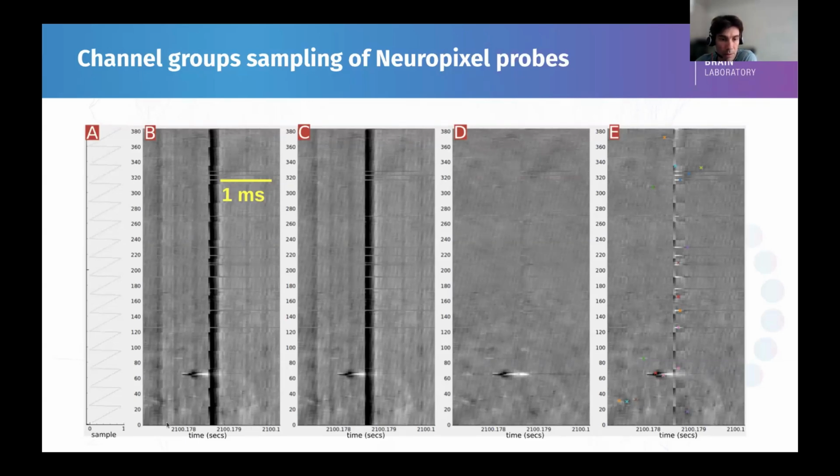So here we can see a very small amount of raw data, 2 milliseconds almost, with a spike here. And we can see this band is noise that's from ground loop noise. And as you can see, if you zoom at this scale, you can see that the channels are not all synchronized. And this is due to the way that the Neuropixel acquires the data.